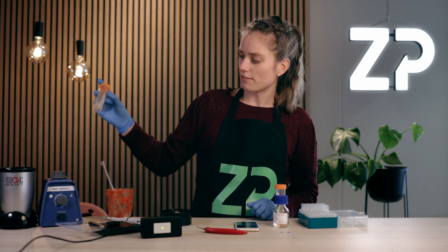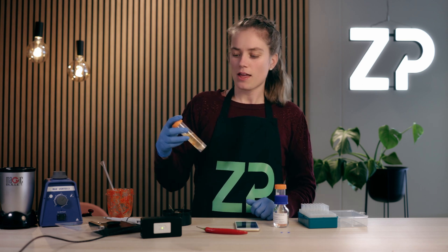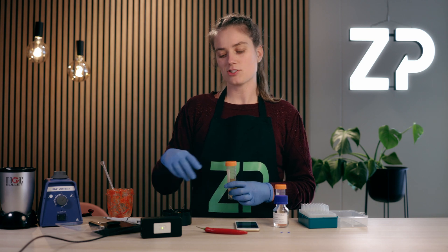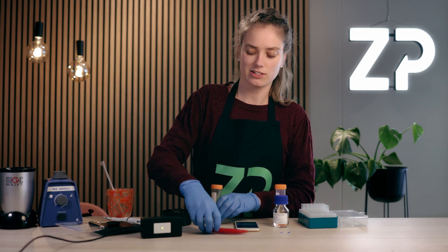I've cheated and I already prepared a solution yesterday, so I'll just give it a quick mix like this. Then I will pipette it onto the sensor and we'll measure the capsaicin in this chili.